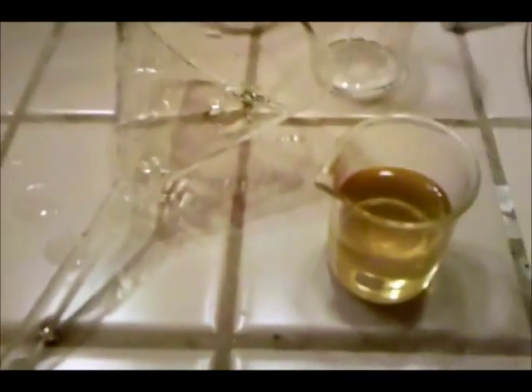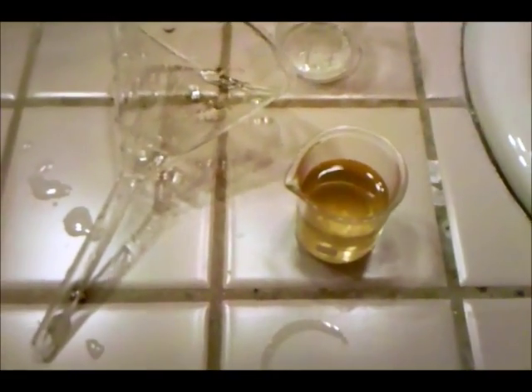I filtered my product to get rid of most of the brown impurity, but you can see the solution is still kind of brown. The next step is going to be to crystallize out my product of potassium iodate. I'm inside now because it's raining outside — the weather has been a big problem for my workspace. I'm going to stick this in my freezer and hope to crystallize out some potassium iodate; however, it's possible that the solution got too dilute during the process and that I'll need to boil it down a little bit first.